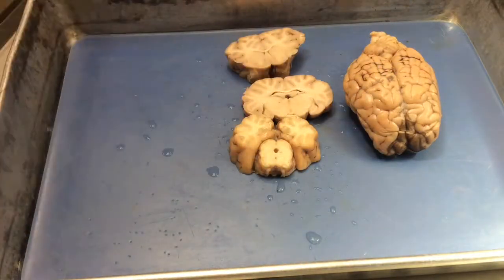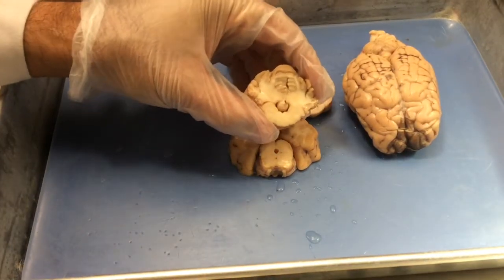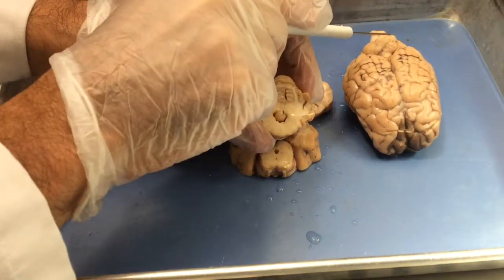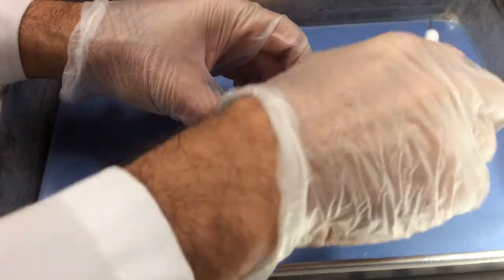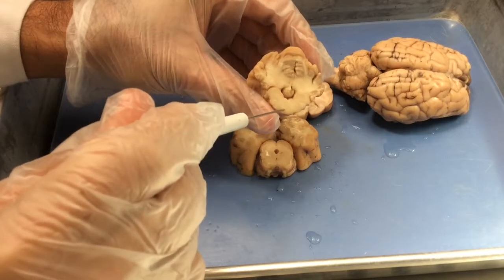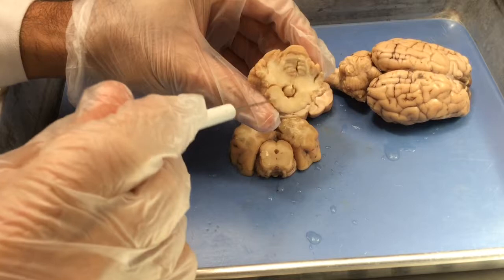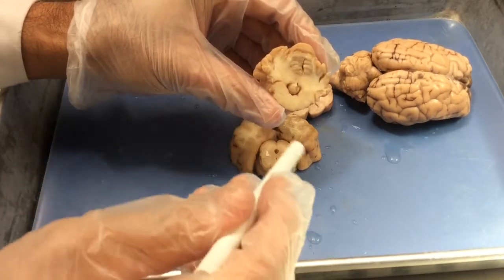As we move further back, we're going to start getting into the hindbrain. Now we are so far back that we're no longer cutting into cerebral cortex. Instead, we're back far enough that we're cutting into the cerebellum. Okay. And the cerebellum lies on top of the brainstem. Probably this is pons if we're far enough forward. This bottom part of the brainstem is referred to as the pons, the more anterior part of the brainstem.